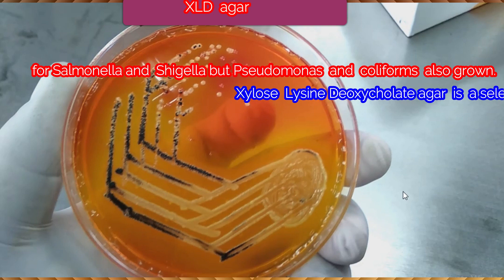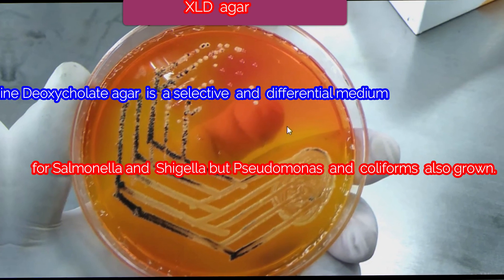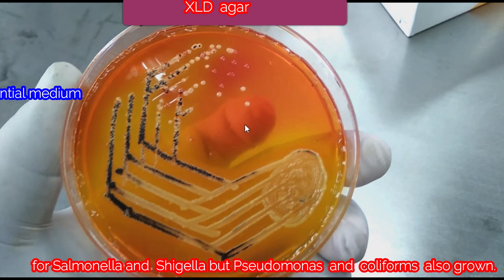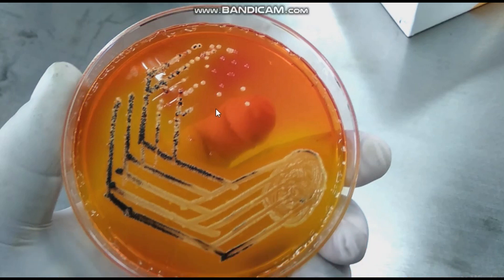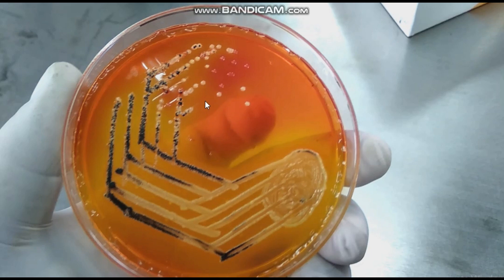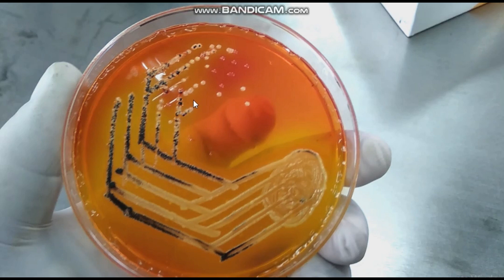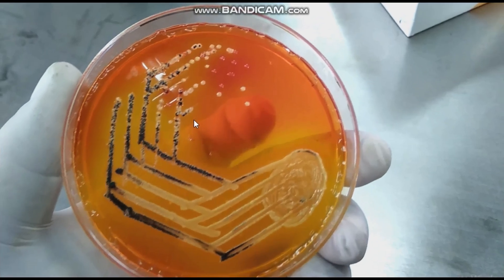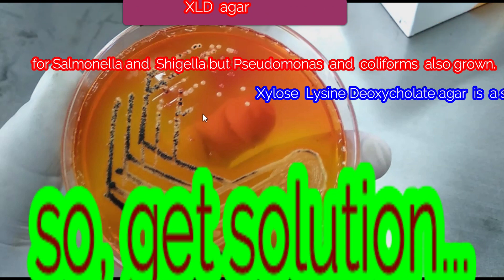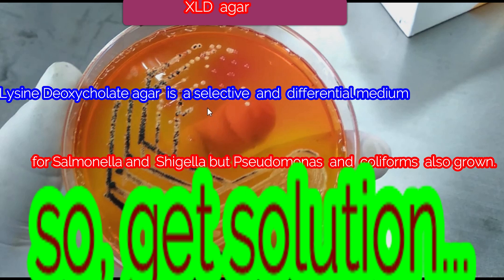Today we are concerned with xylose lysine deoxycholate. XLD agar is a selective as well as differential medium. It contains bile salt, that is sodium deoxycholate, which inhibits the growth of gram-positive bacteria. It is differential because it can differentiate Salmonella and Shigella species, unlike other media.